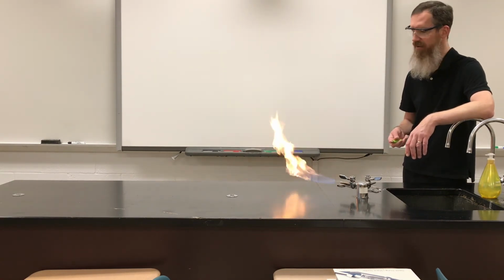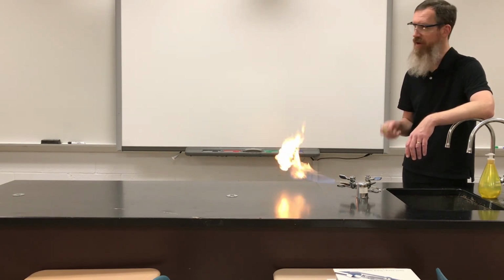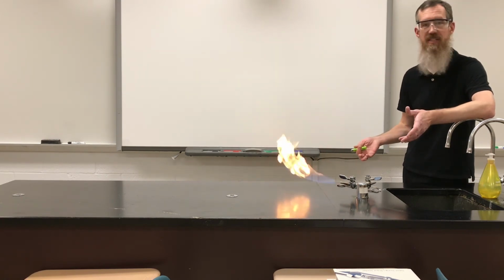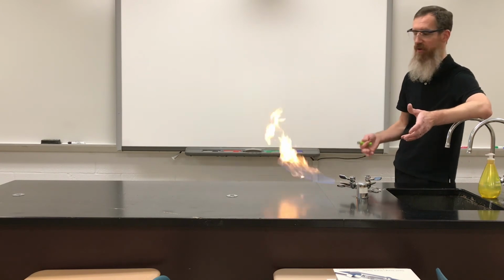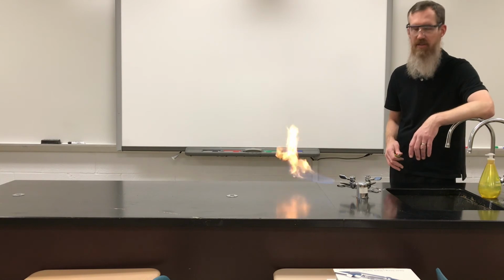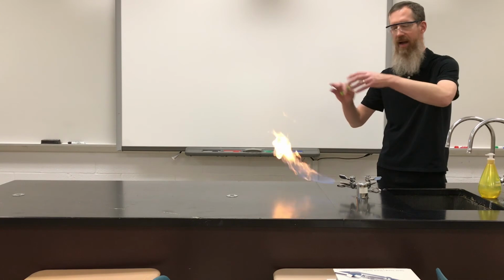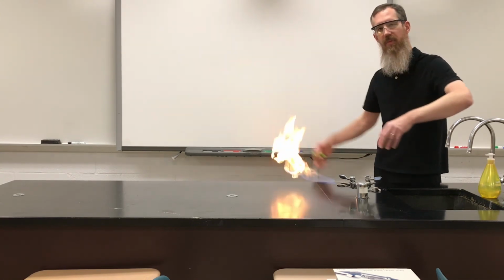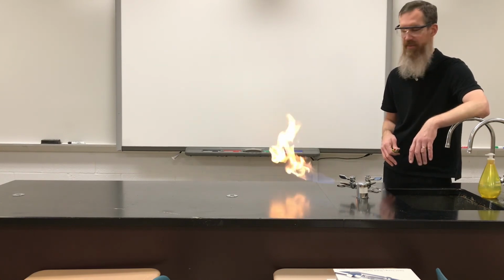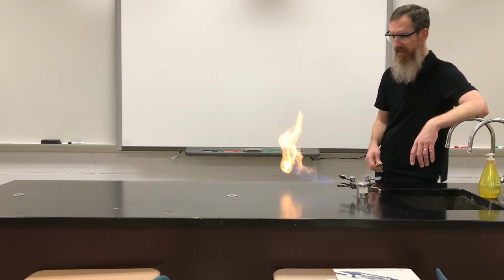Another product that you can't really recognize here is water. Water is being produced right now. But the water is so hot, obviously, that you don't see it in liquid form. It's in gas or vapor form, and it is, again, floating away, clear and colorless. We don't see it. Now, if we were to come by and try to chill some of this gas nearby, or if this were happening outside, we might see puffs of cloud, and that would be the water vapor condensing into little water droplets. So that's it.